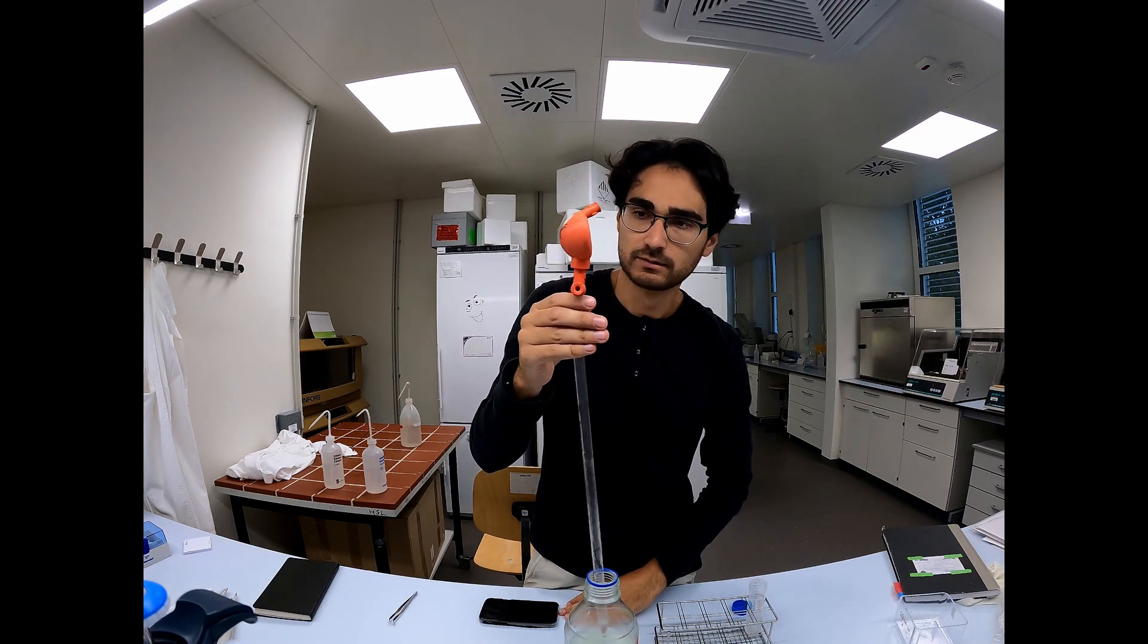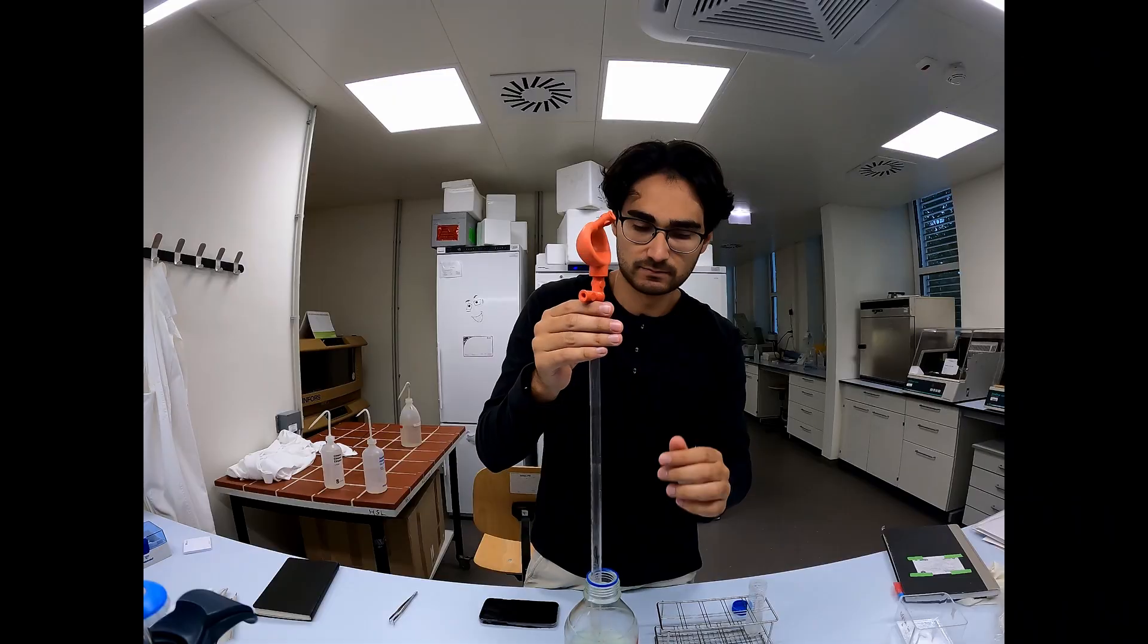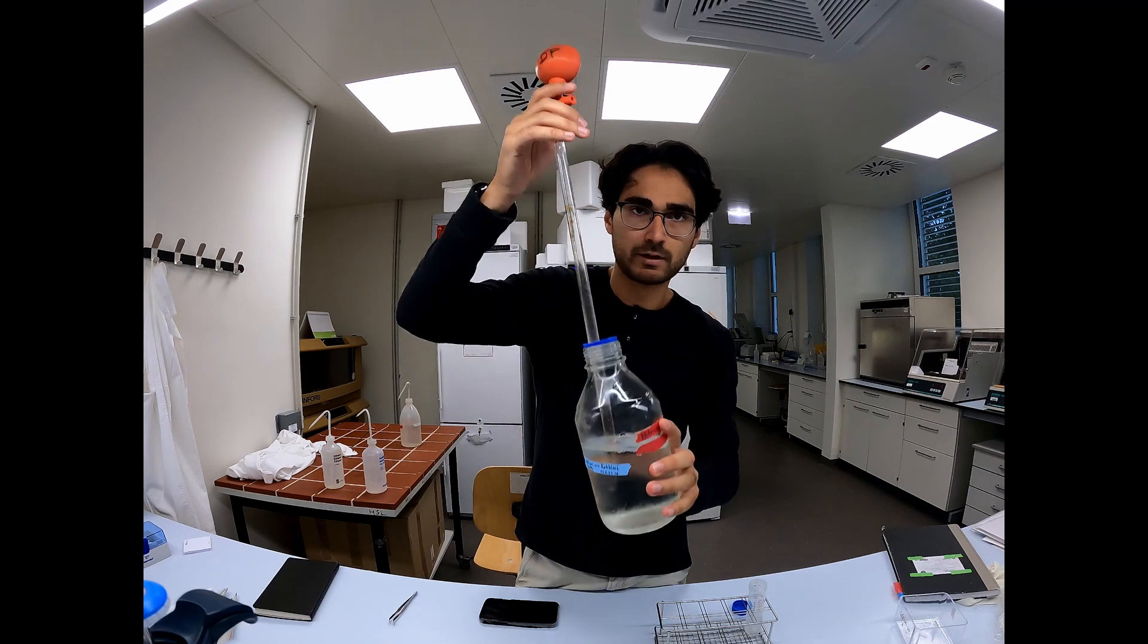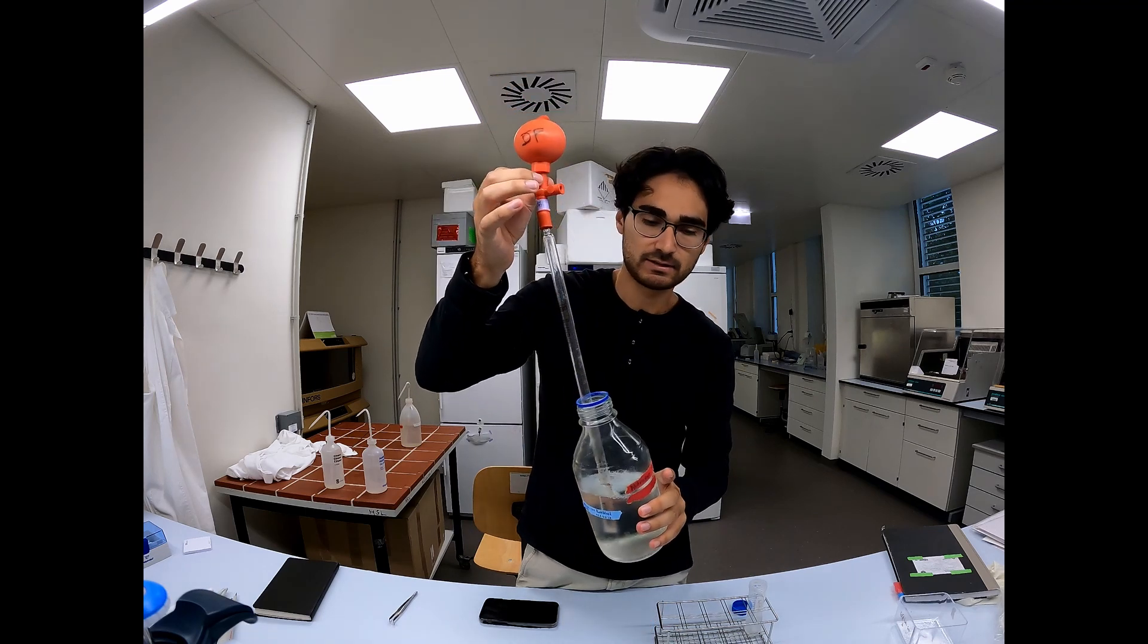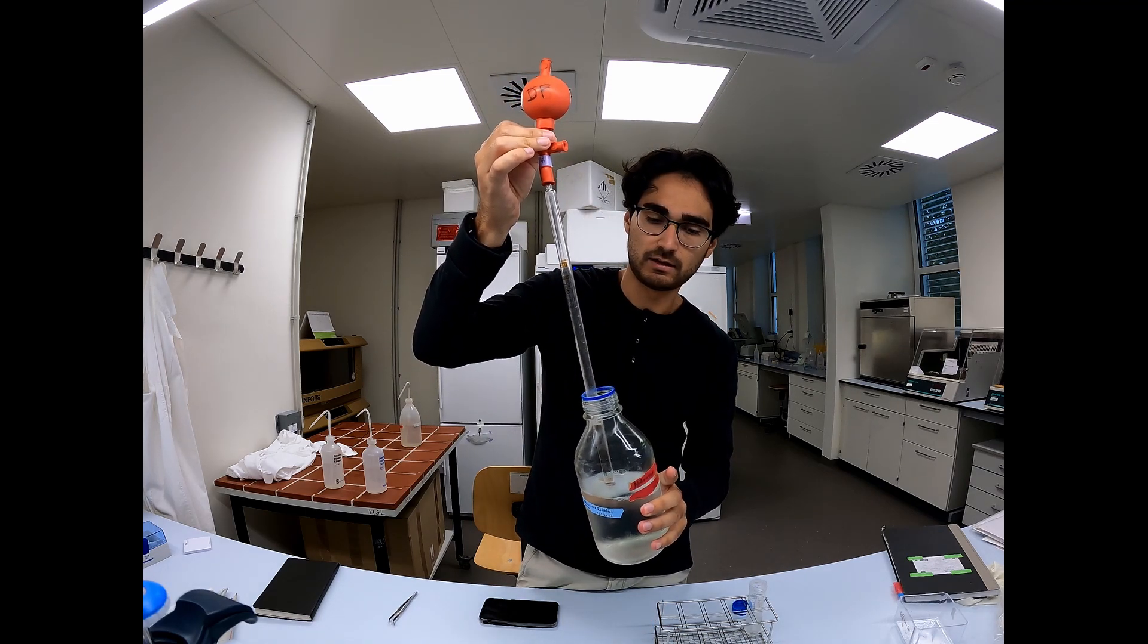And now you can suck up liquid. And for that you press S. So you have liquid here. You press S. And then the liquid comes up.